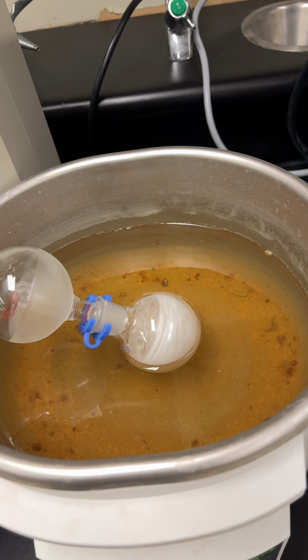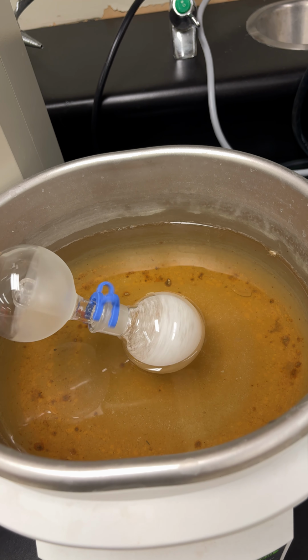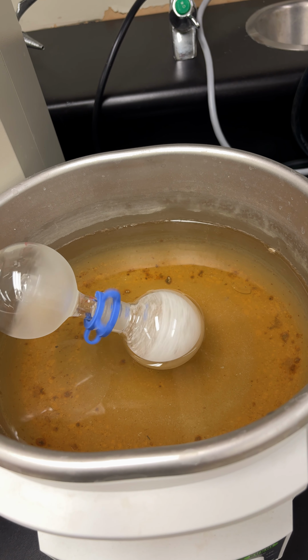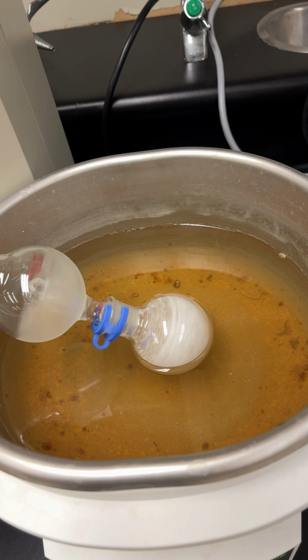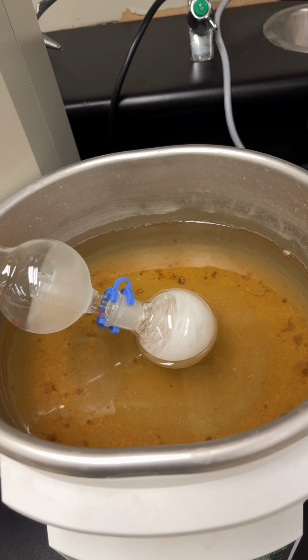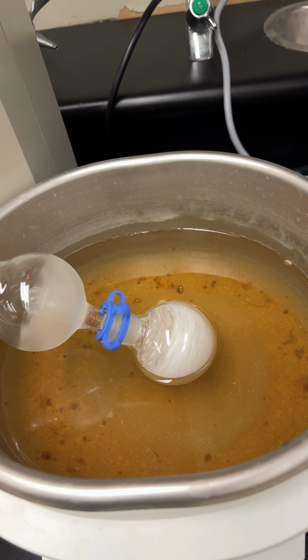There we go. See, it looks kind of like a snow globe now. So that means all your ether's out. So leave it on for an extra 30-45 seconds. That'll remove any residual ether that is in there, because if it's not dry, then it's going to give you a false amount of product that you have in there.